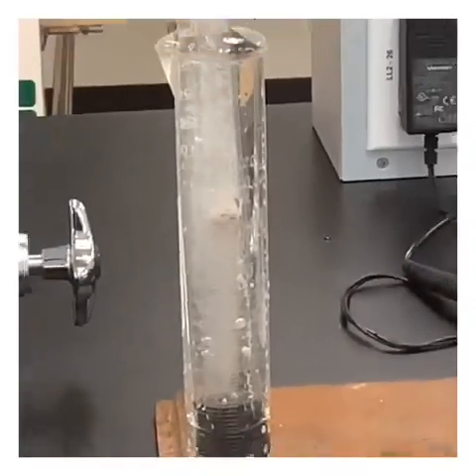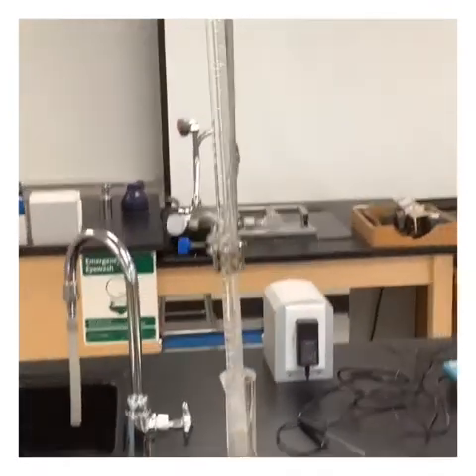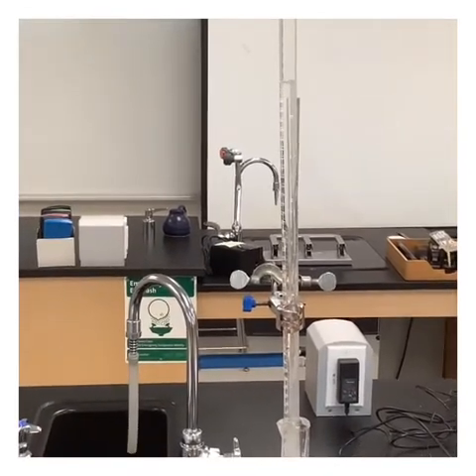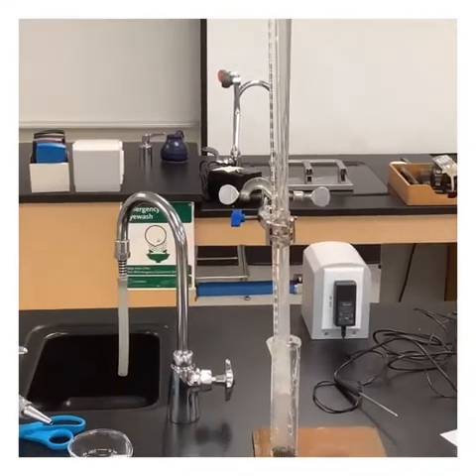So we're still going, but we've got a lot of action going here now. If we zoom out a little bit, we can see we're getting a huge bubble up at the top. This thing is reacting quite nicely, but we still have plenty of metal down there at the bottom.